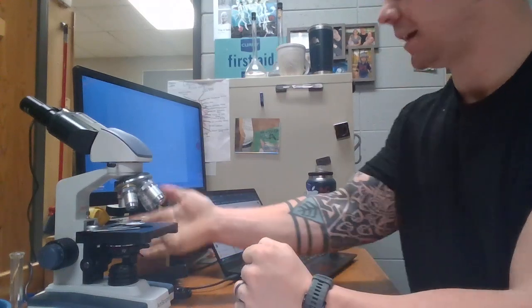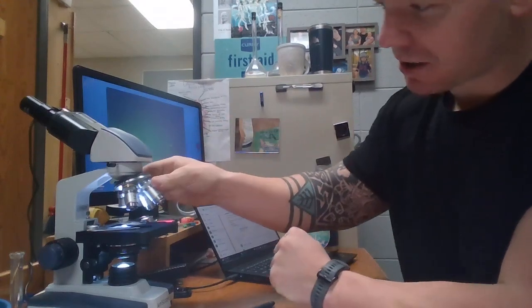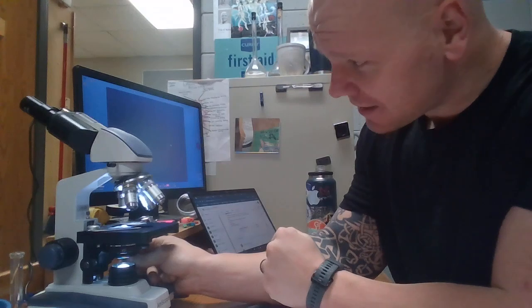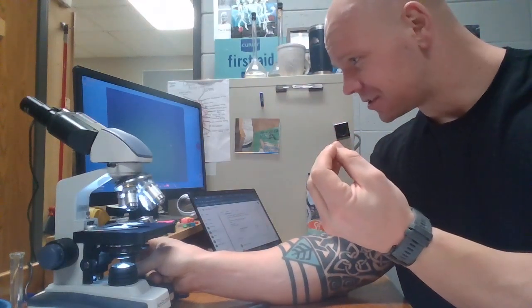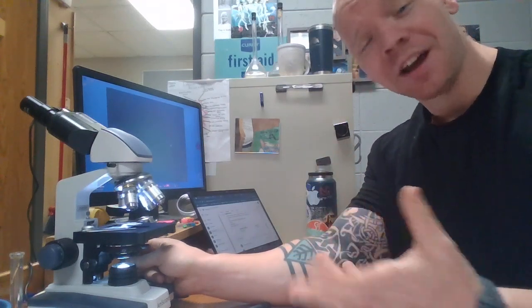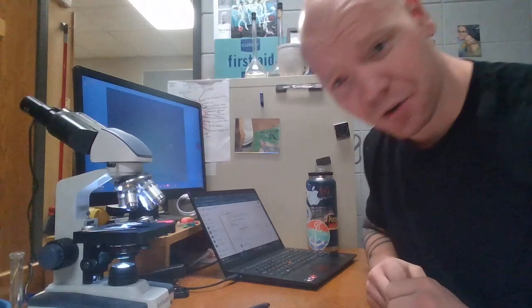Now what I like to do when I have my microscope all set up is first I'll turn it on, I open up the diaphragm all the way, make sure that my objective lens is on the furthest zoom out, and then what I like to do in order to find my slide is I will move the stage around until I orientate my slide directly over the light. And I'll know that my specimen slide is over there when the light changes color, all right? So it's usually like a white, and then as soon as I start to slide something that's colored over it, it might turn like a slight pinkish. And when that happens, I know that I have that slide in the correct location, and then I can start to do my coarse and fine adjustment.